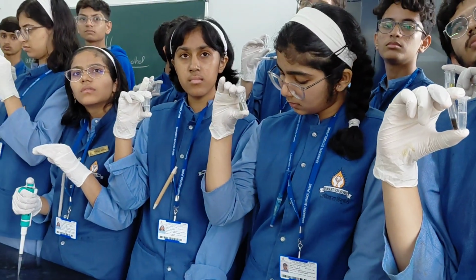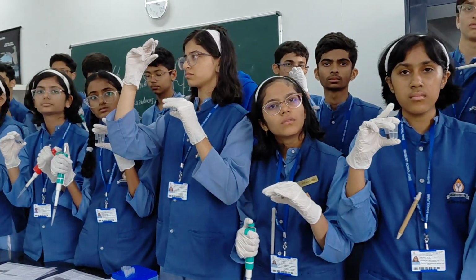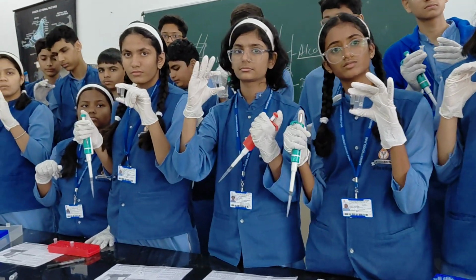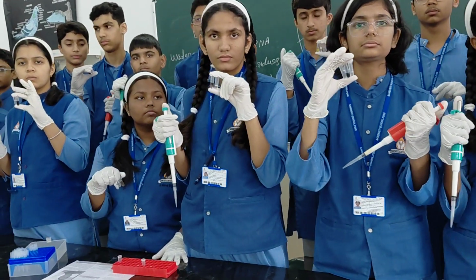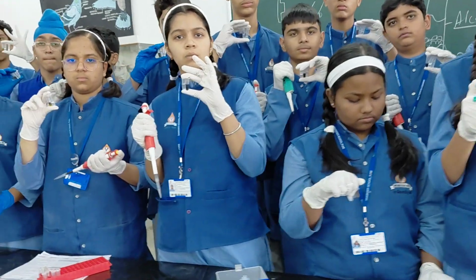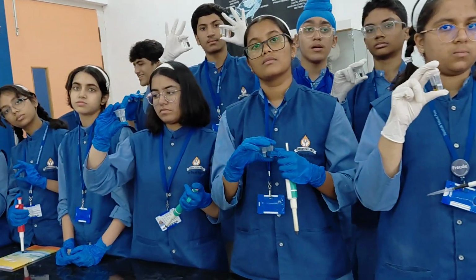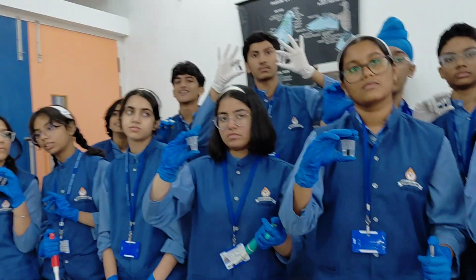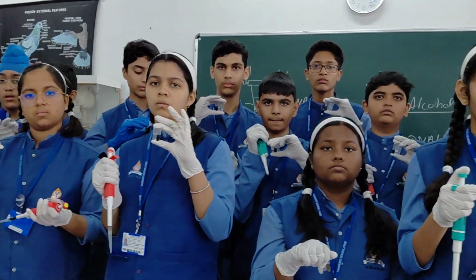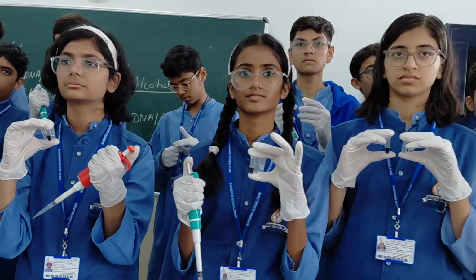Then you add water or Tris-EDTA buffer solution, called TE buffer, Tris 10 millimolar, EDTA 1 millimolar. That will give storage capacity to the DNA and you can store it in the deep freezer for years, up to 1000 years. Right? Whatever amount of DNA you isolated today from the samples, you can test the DNA about 1000 times.